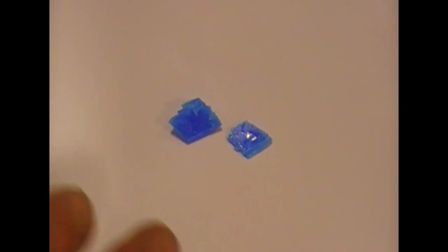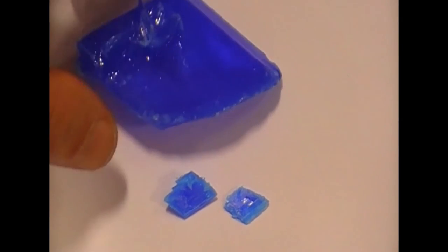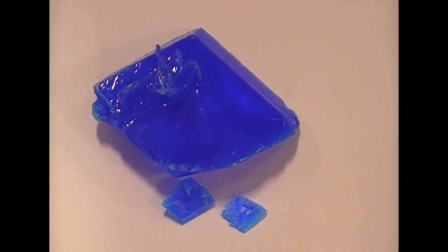And you can see they've got a very regular diamond structure. And the bigger they grow, the more regular shape they get until you can have one like this. If you leave it long enough.